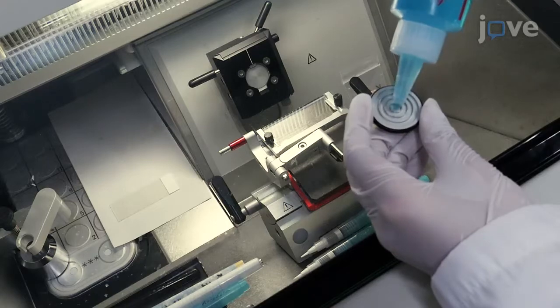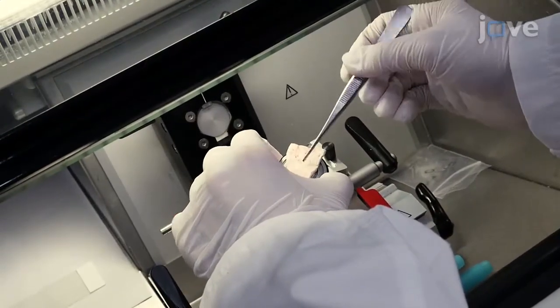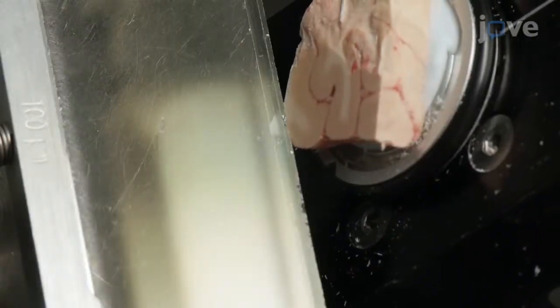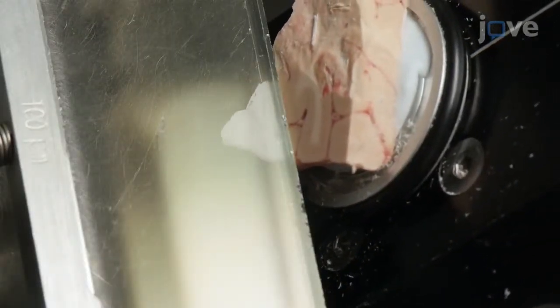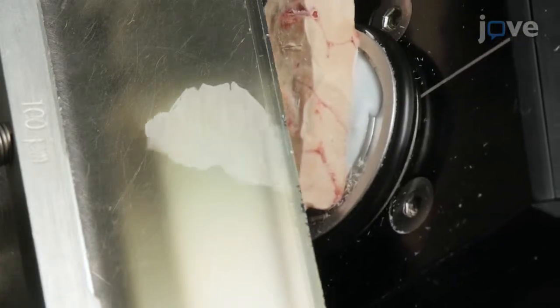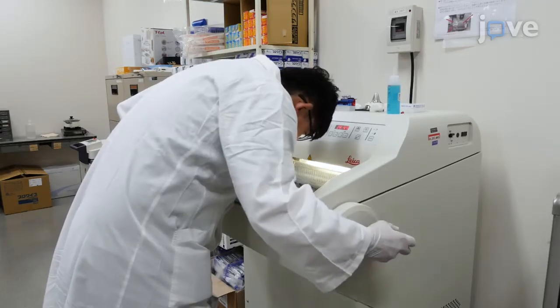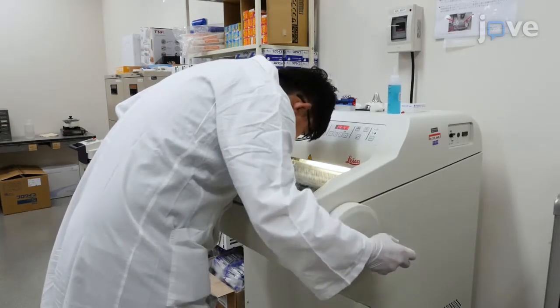Put the frozen autopsy brains on the stage along with a small amount of optimal cutting temperature compound. For IMS and immunohistochemistry, cut 5 to 6 sections from each tissue sample. When the blade is just starting to cut the tissue, turn the wheel and face the block until all of the tissue is exposed.